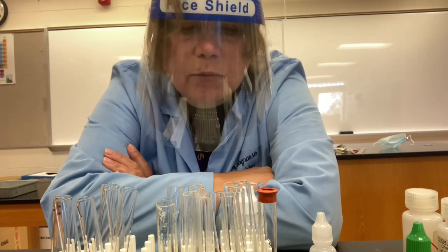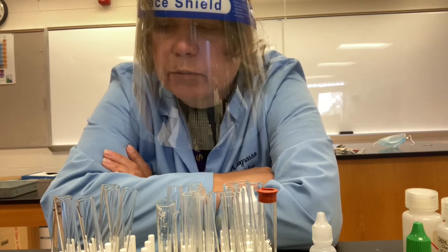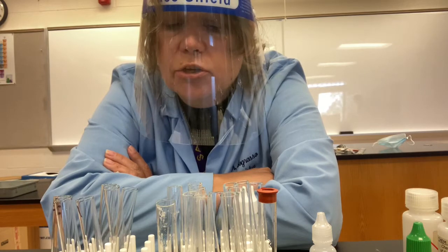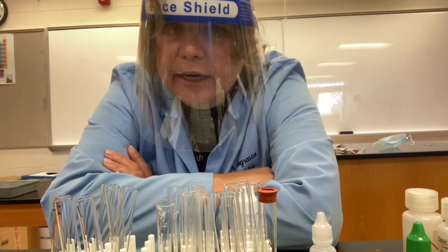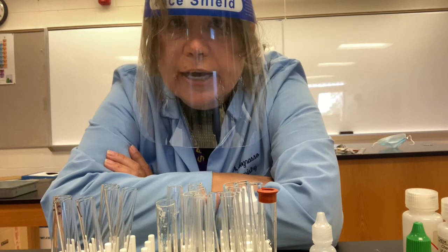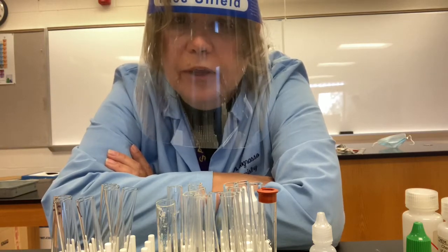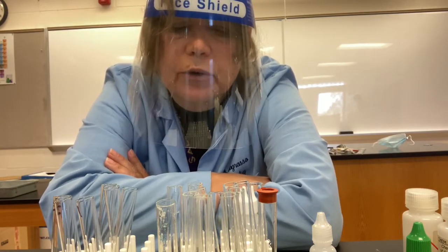Now this is going to be a little bit more complicated because what we're going to do is a reaction where the hypochlorite ion reacts as if it is Cl2, even though it's not. It is a test for hypochlorite ion, not chlorine gas, but it is going to do a similar reaction that you see in your book. And it's going to react with iodide ions to produce iodine, I2. And then we're going to show how we can visualize the I2 at the end of the reaction.